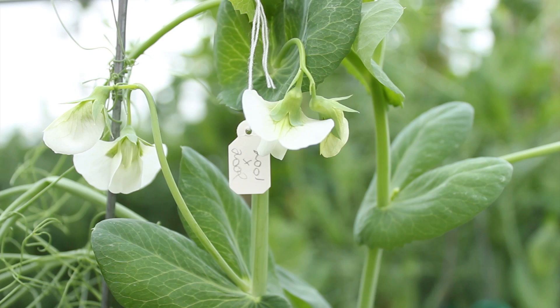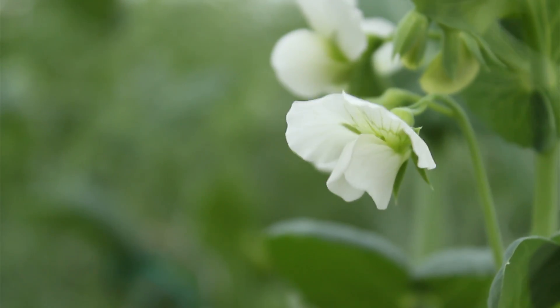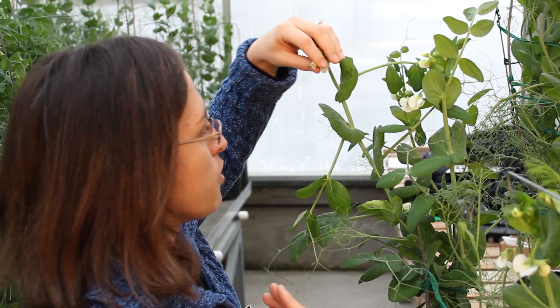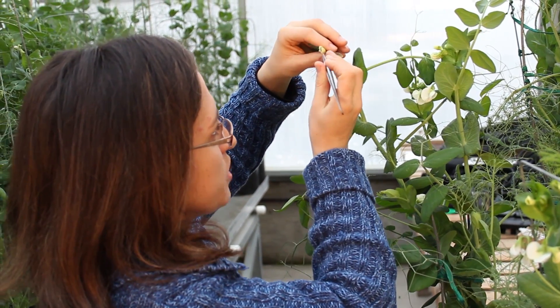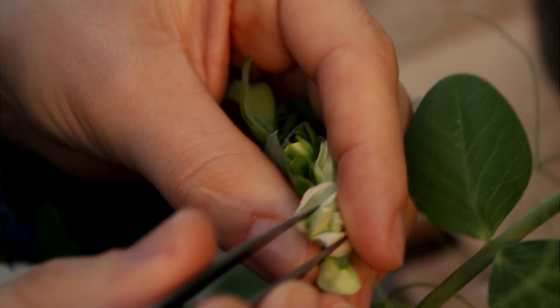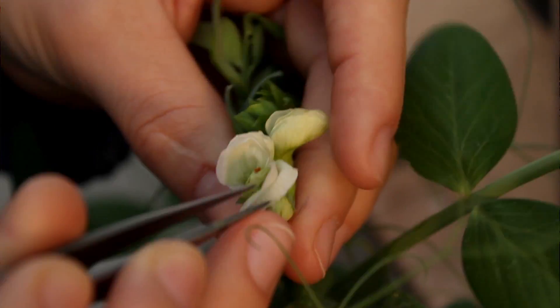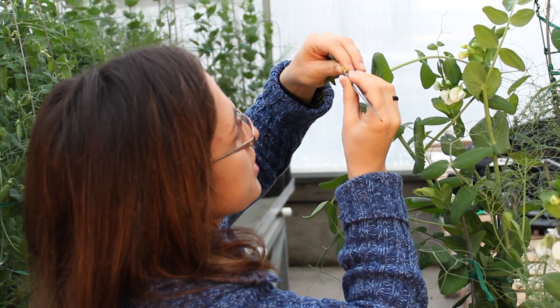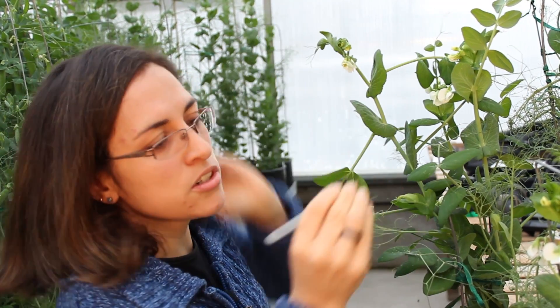Now I'm going to move to the male plant and choose a flower that's further in development, so the pollen was already released — which can be this one right here. And when I open this flower, I can see they have more white on them. And I'm going to go ahead and scoop up all the pollen — that's what I want, the pollen released.